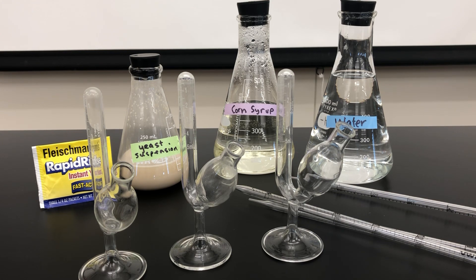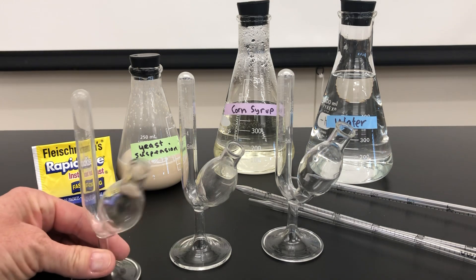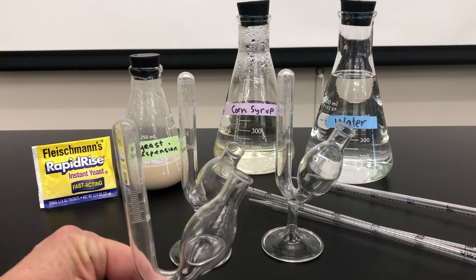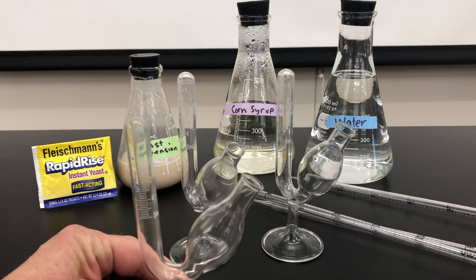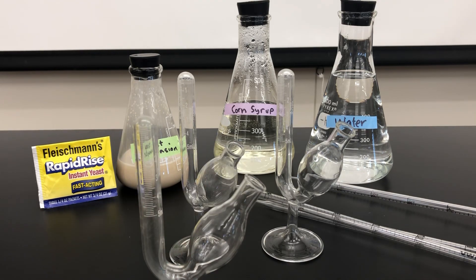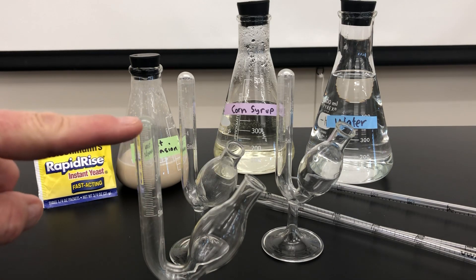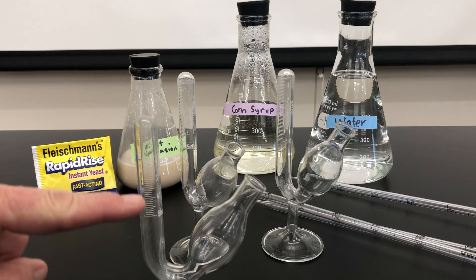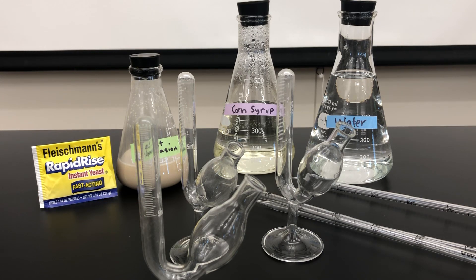Using an apparatus known as a fermentation tube, this will allow us to measure or collect in the graduated stem the amount of carbon dioxide.